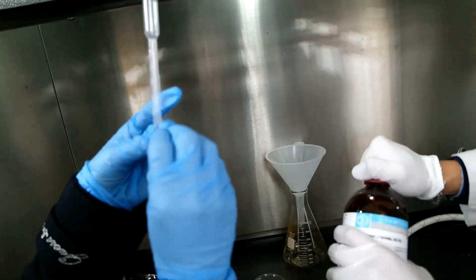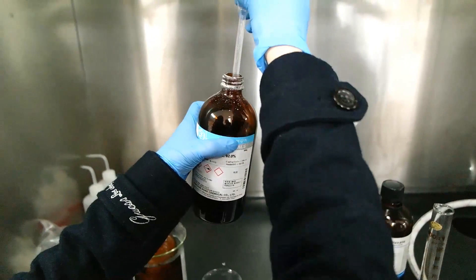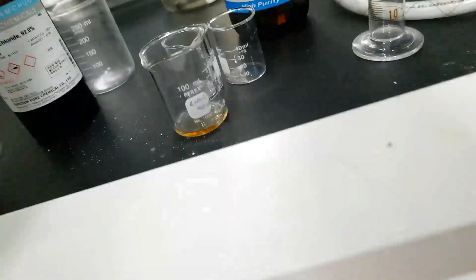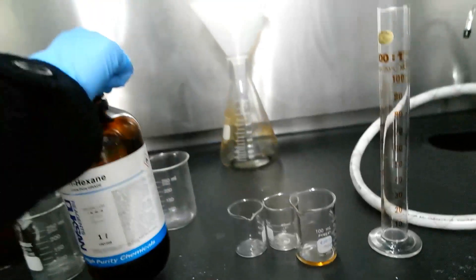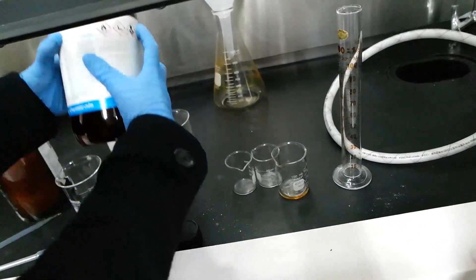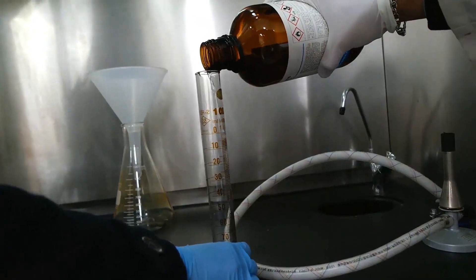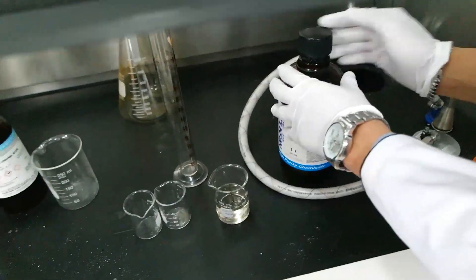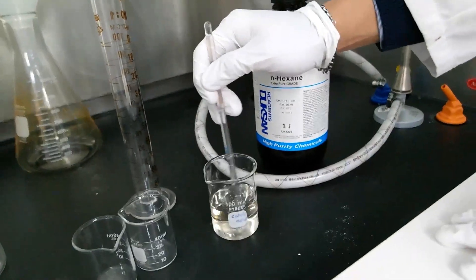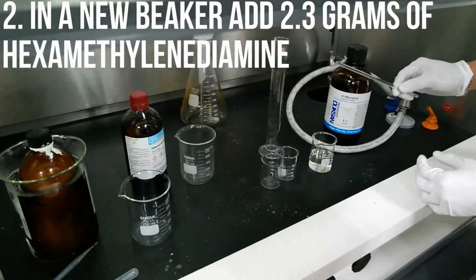Can you come closer? So this is 1 ml — I'm just gonna take it. And hexane — would you like to pour 50 ml of hexane into this? Let's do it. Mix it together with a glass rod.